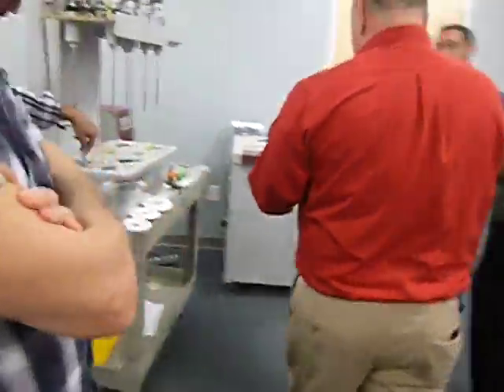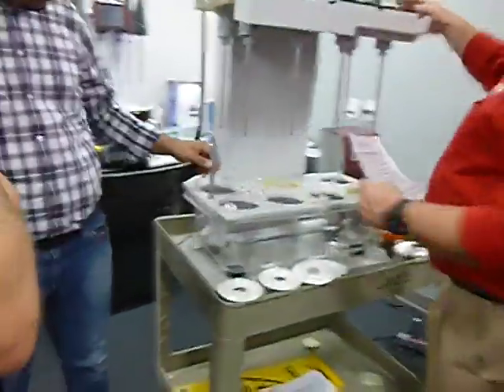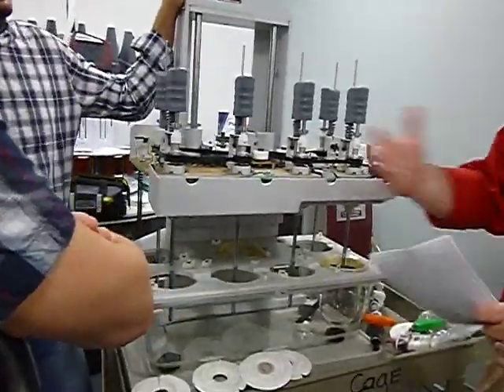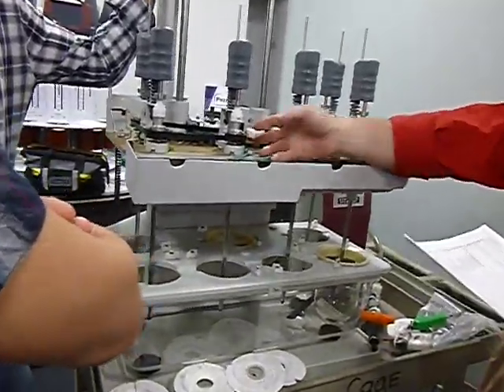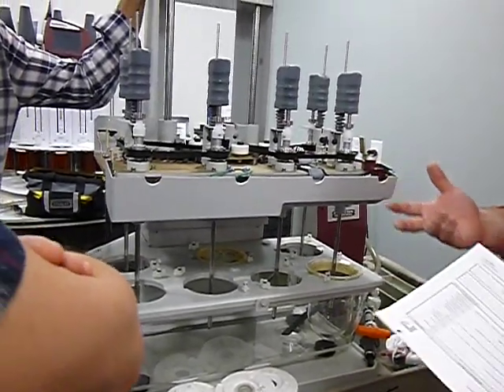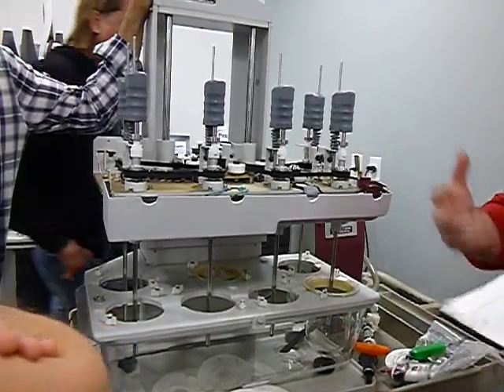So now we're up to idle tension, which we looked up on top here. I did go out all the steps, so I'm now going in steps. Here's the idle tension. We check all the tension on each one of the idle wheels and the belt wear. You're just checking to make sure it's in good condition, no cracks, not a lot of pieces missing.